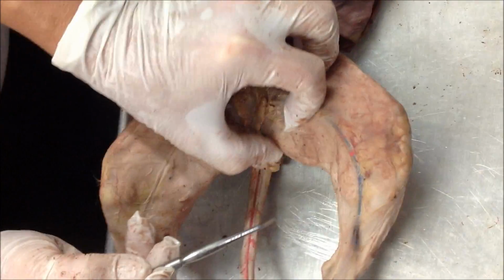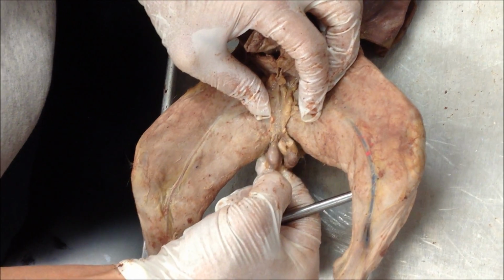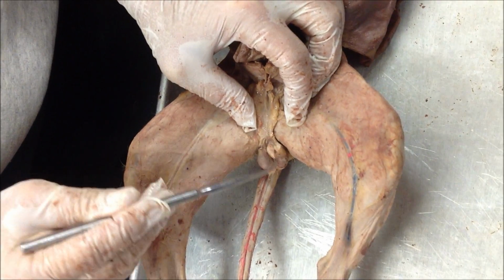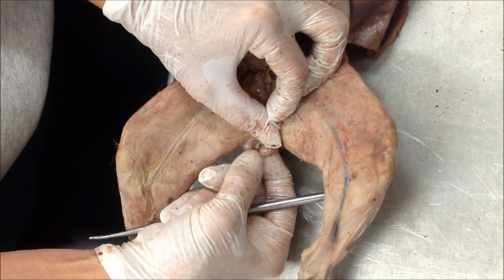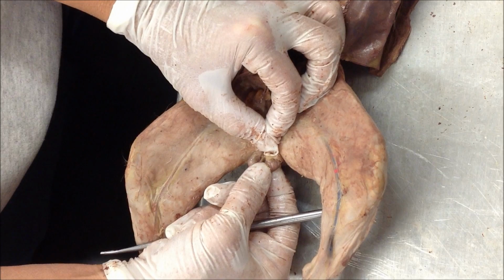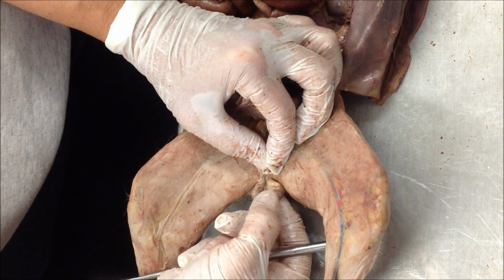Okay, so this stuff on the outside, that's gonna be scrotum, right? So this is a testis and this is a testis. When you pull this way, see how there's like a little cap right there on that? That's gonna be the epididymis, because it's above the testes. Epididymis, so that's the epididymis, and then this is the testes.